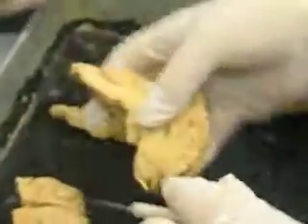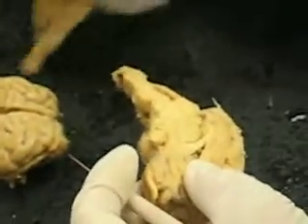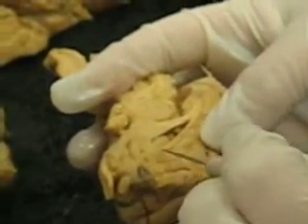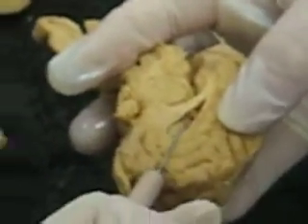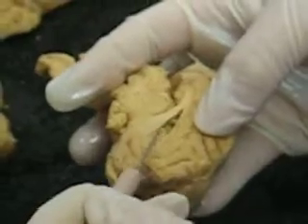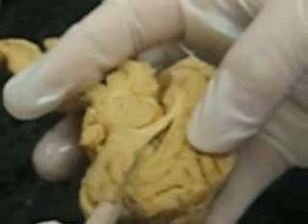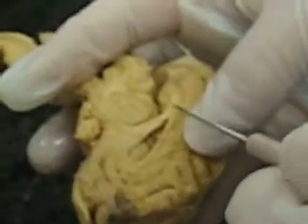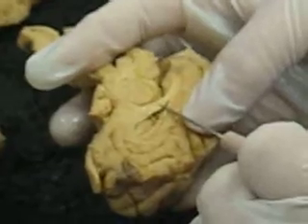Corpus callosum. Corpus callosum is a band of nerve fibers that connects the left and right cerebral hemisphere. So it's kind of thin there. That band of fibers right there, that's the corpus callosum. Septum pellucidum is a layer of tissue that actually surrounded this opening here. You'll see this in the brain model, it's still intact. Septum pellucidum is just a layer of tissue right in there. And then the fornix is down below here. So the fornix is right there.